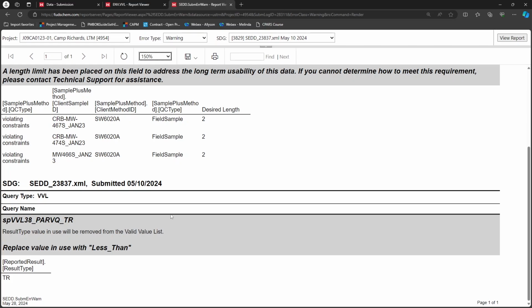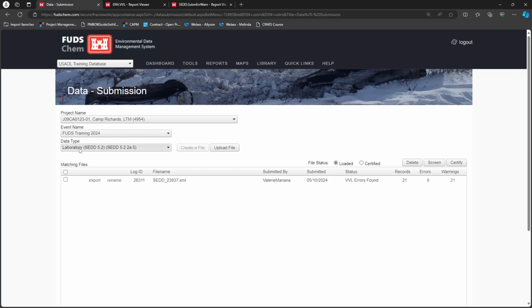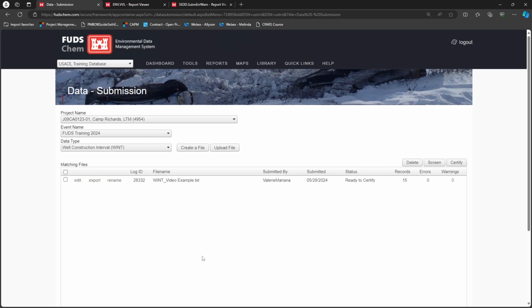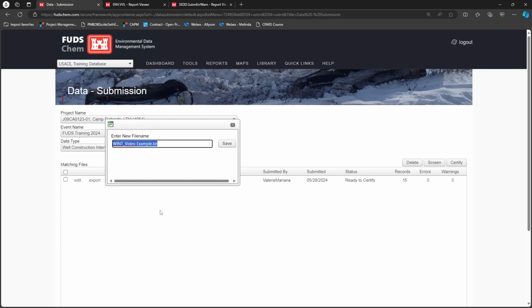Once the file has 0 errors and warnings have been reviewed, it is time to certify. As a best practice, click Rename to rename the file. The FUDSChem user manual, found under Quick Links, includes an appendix with recommended naming conventions for files.